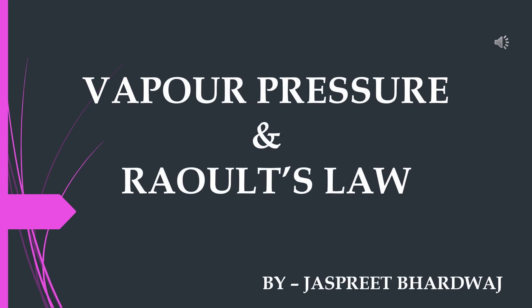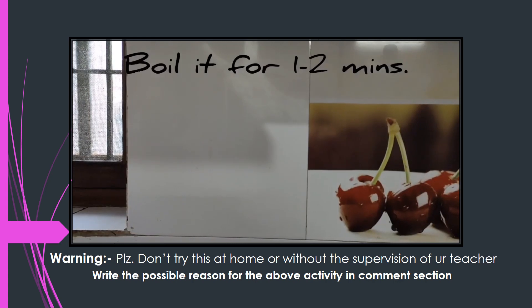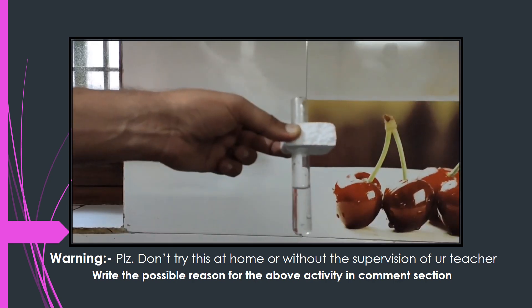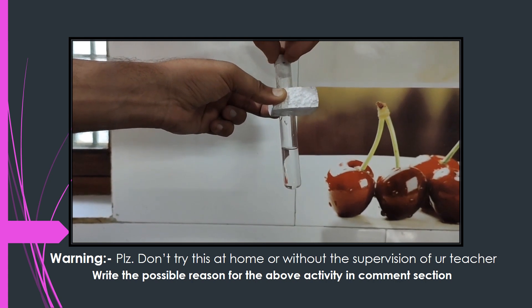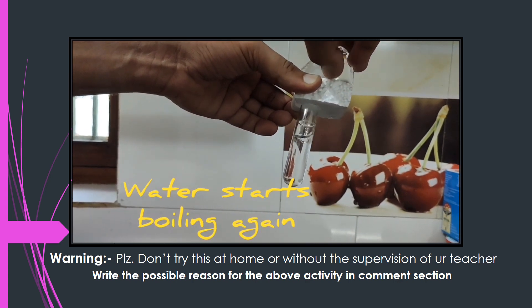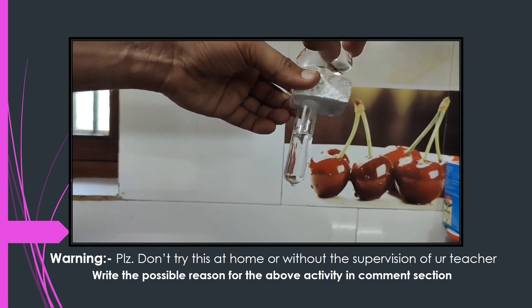Today we are going to start a very interesting topic: Vapor Pressure and Raoult's Law. Take a borosil test tube, fill about one third of it with water. Now carefully boil the water. When there is steam coming out from the top of the test tube, place a stopper and seal it firmly. Allow the water to stop boiling — now the temperature of the water is going down. Take an ice cube and rub it on the top of the test tube. The water inside the flask starts to boil again. Is the ice heating up the water? Obviously not. So what is causing the water to boil? It's the Vapor Pressure.